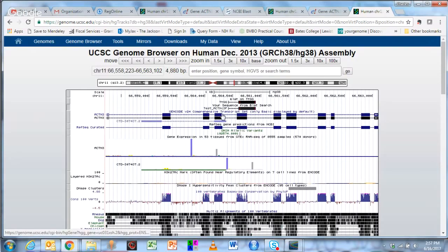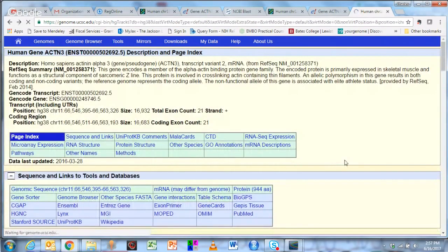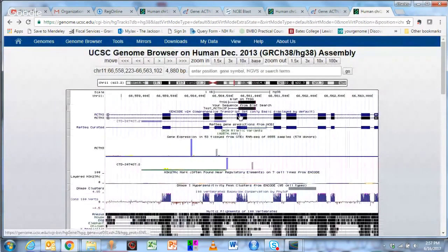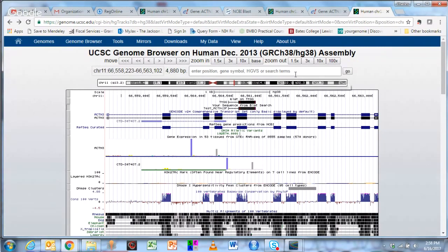In this case, the gene codes, I believe, in this direction. So this is exon, whoops, didn't mean to do that. If you mouse over, this is exon 15 and exon 16. So we actually PCR'd and then sequenced a piece of exon 15 on into the intron 15. Please note that this red line actually is significant, and that's the likely variant. It looks like there may be a variant out here in the intronic sequences, which is probably not relevant.